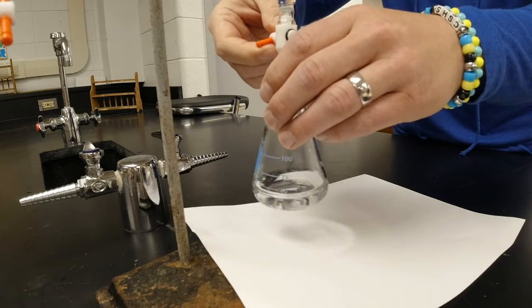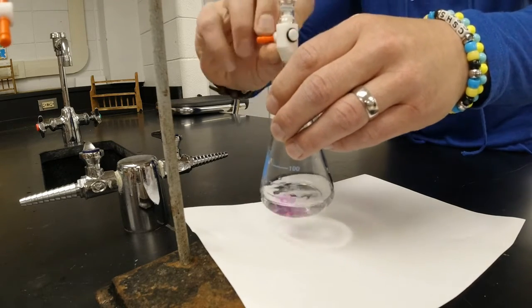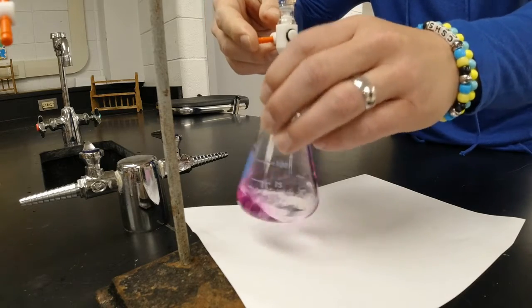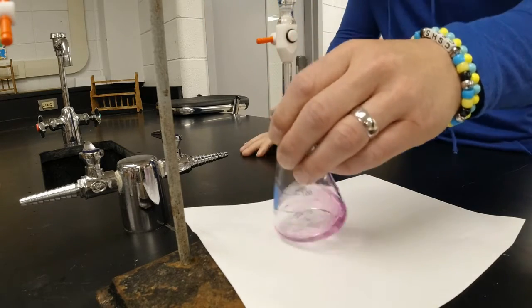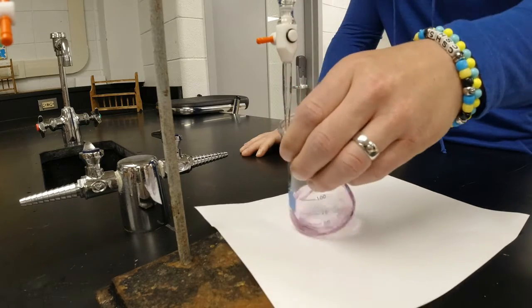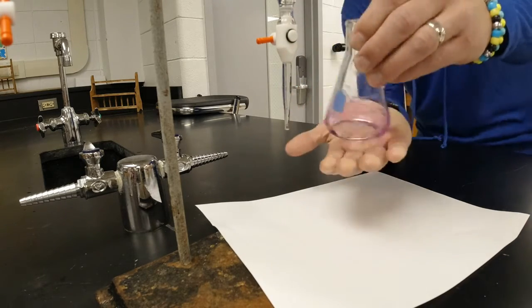Well, don't get mad at me, Mr. Brown, if I get too dark magenta. Oh, I'm getting close! Yeah. Oh! Looks awesome. Honestly, probably too much for ISU standards. I'd be in trouble. No, I think that looks pretty good. All right. That's pretty good.